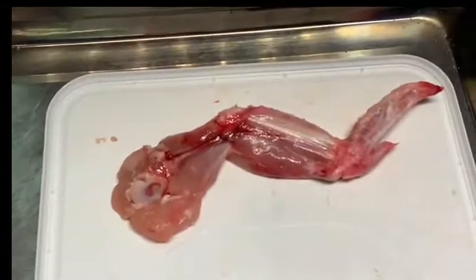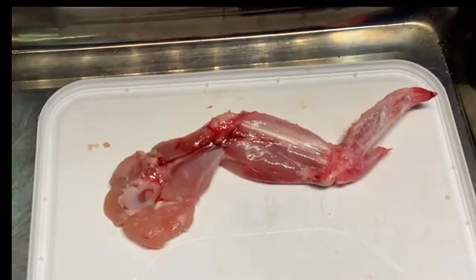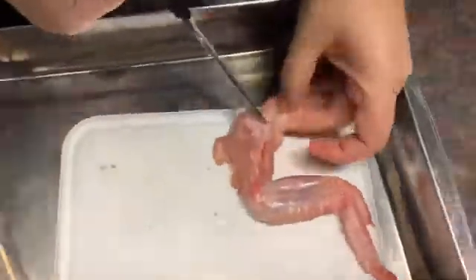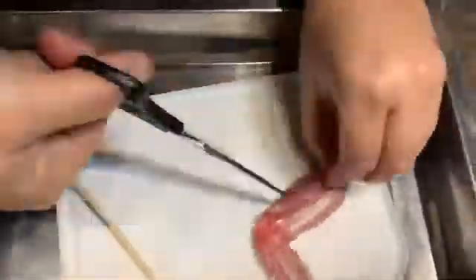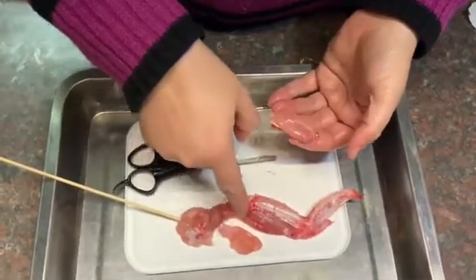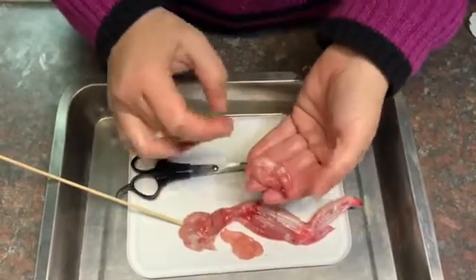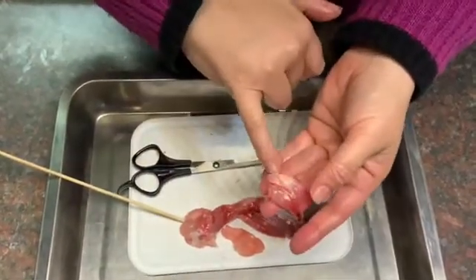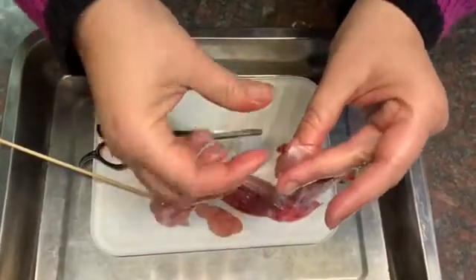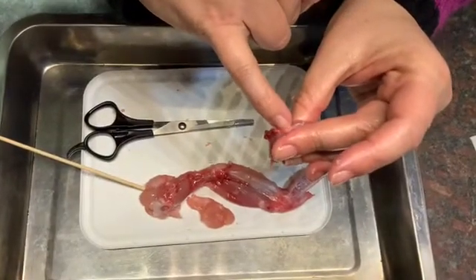Once you've done your drawing, you can then start to dissect this fully and take all the muscles off so that we can see the joints. This is an individual muscle that we've now cut off from the top of the humerus — we've cut off the tendon on each side, and that's what the muscle looks like. You can see the tendons here: that is the tendon cut off on one end, and underneath this blood vessel is the end of the tendon at the other end.